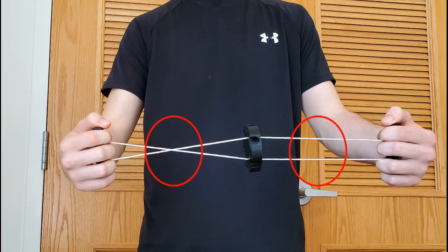There are a couple things I learned from operating the device. The first one is that it really helps to get the centrifuge started if you have the two handles twisted out of sync, as shown in the picture.